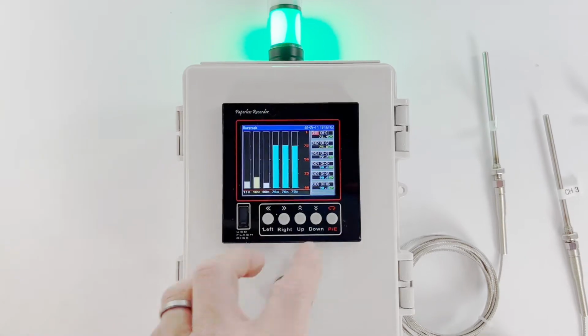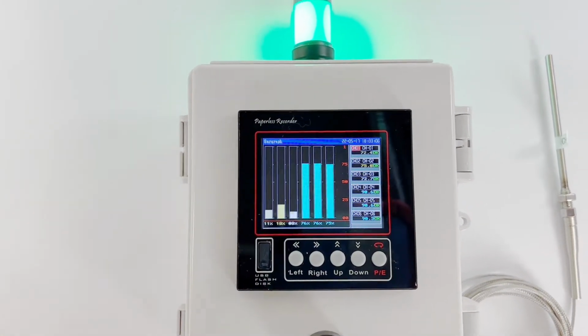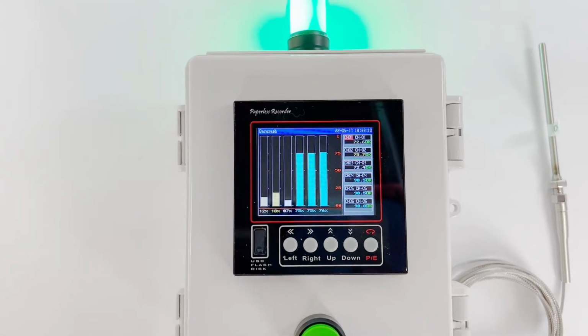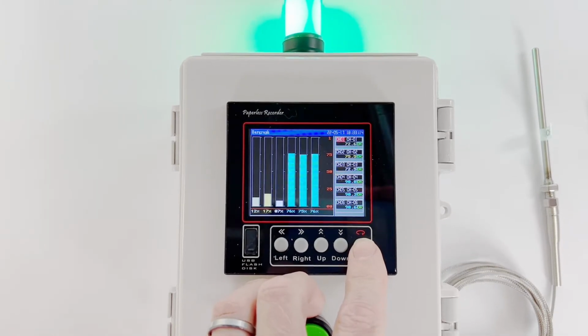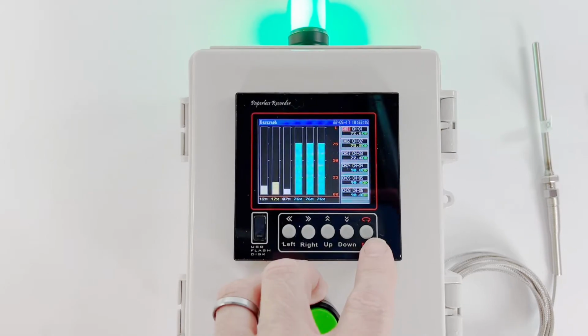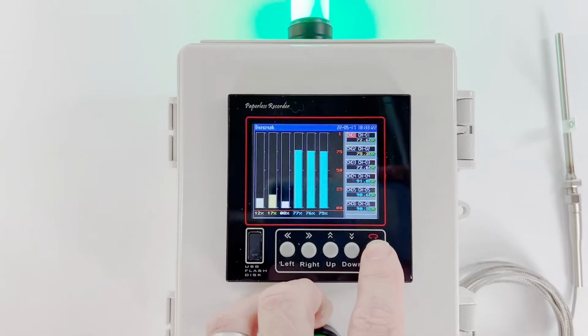There's a bar graph, which is useful if you want to compare the values of things that should be identical, like if you're monitoring an oven and you have 6 points in the oven, you can spot the deviation really clearly with this bar graph. And channels 4, 5, and 6 all have resistors on them, so they're just dummy values.